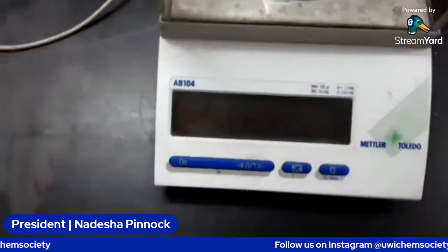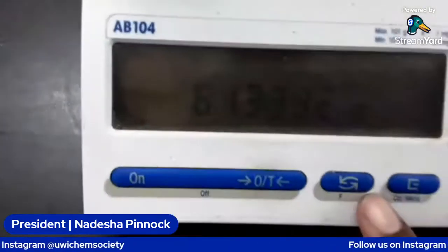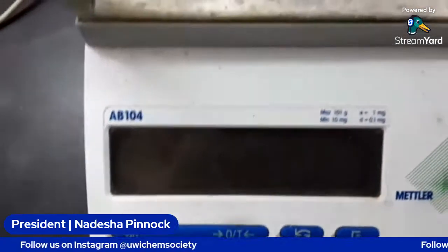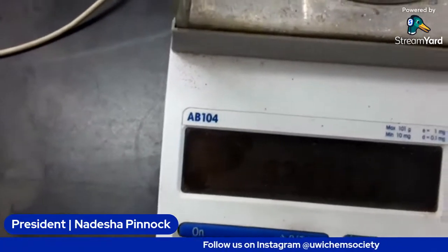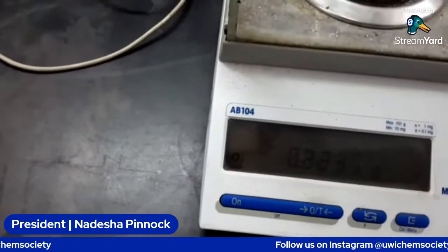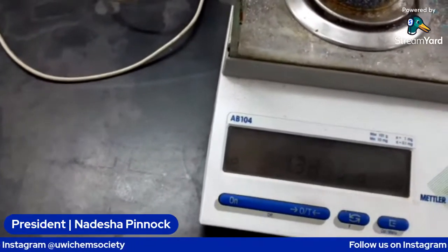I'm going to add a conical flask to our balance. And this is an analytical balance. I hope you guys can see the numbers. It's very dark, but I hope you can see. There we go. We're going to zero the balance. And then we're going to weigh out 2.5 grams of iodine. The scale itself is a bit difficult to see, so you guys may not be able to see the numbers while I'm weighing.